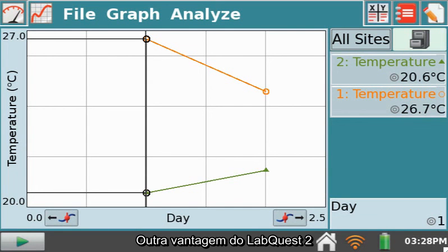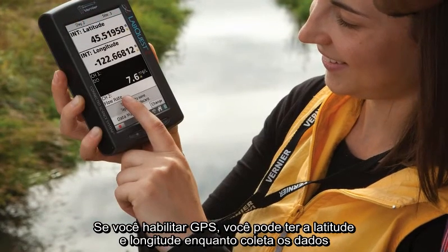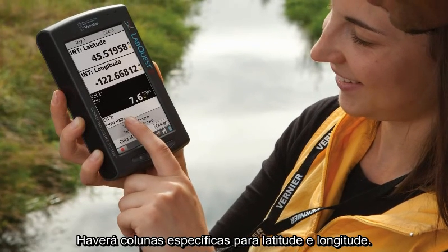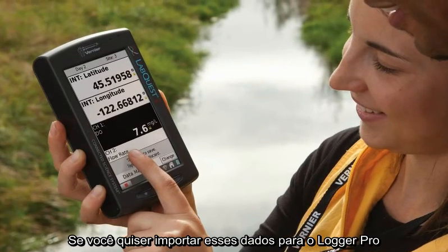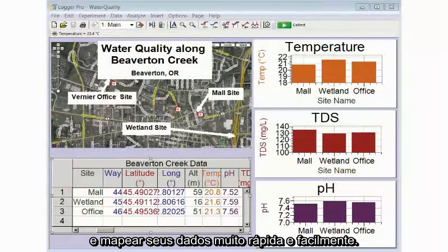Another nice thing about Labquest 2 is that it has built-in GPS. So if you enable that, you can get latitude and longitude while you're collecting these data. There will be columns specifically for latitude and longitude, so that if you choose to import this data into Logger Pro, you can use the File Export to Google Maps feature and map your data very quickly and easily.